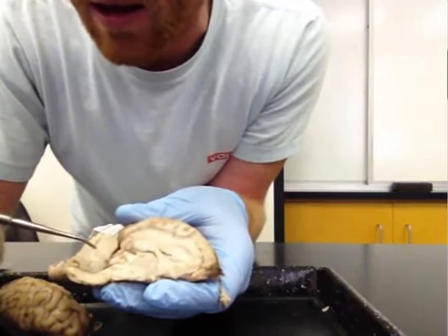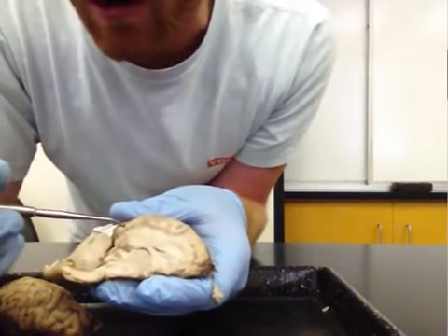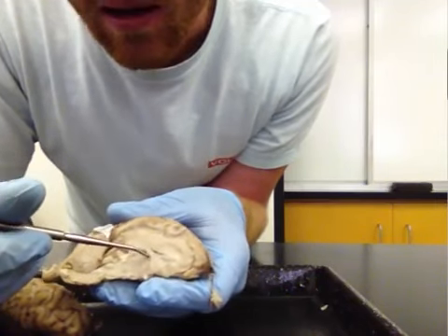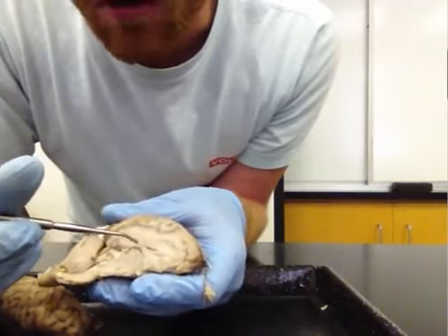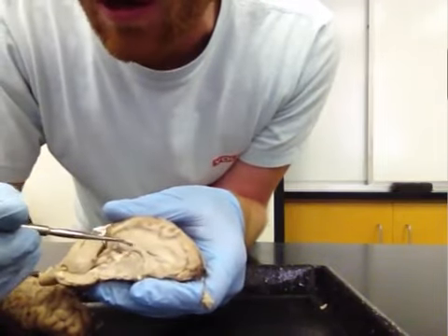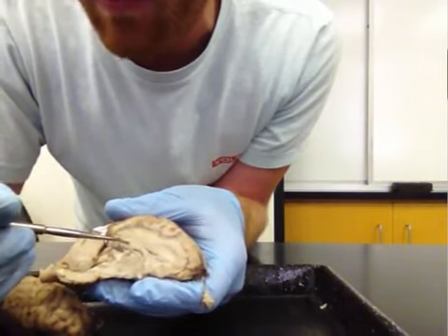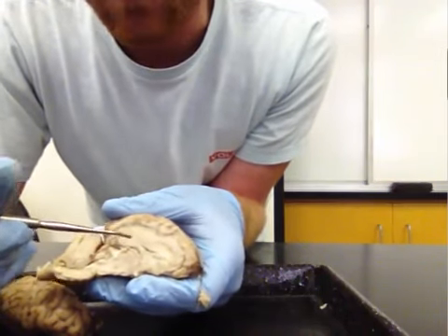You can see now the inside of the cerebellum. Finally, a really important white matter structure. You'll be able to see this really intense white matter. And this is the corpus callosum right here. And you can see that it makes this almost inverted C shape or inverted U or C-like shape. And this white matter is connecting both hemispheres together here.